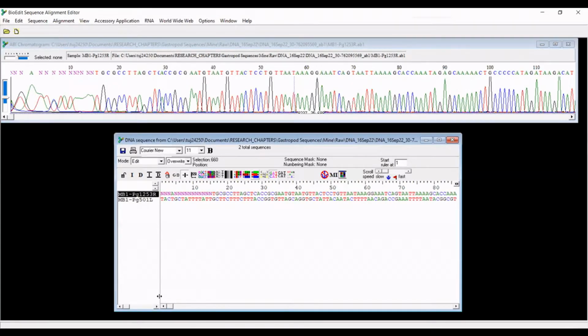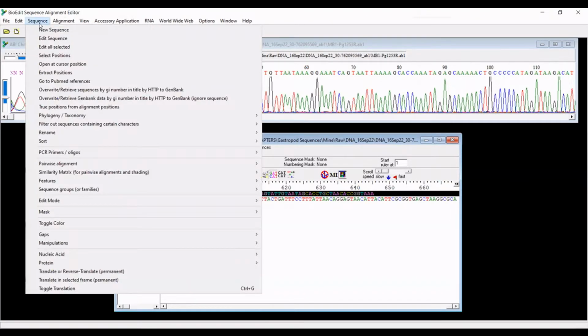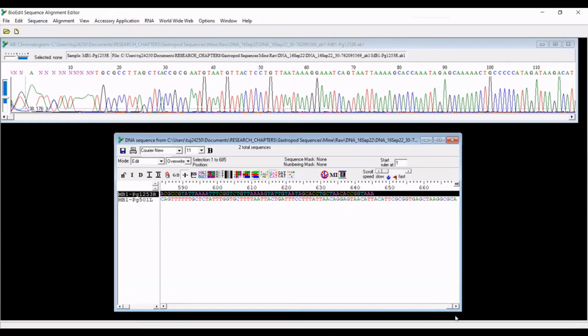We're going to delete the ambiguous regions. So everything looks honestly pretty good. Literally until it doesn't. So I'm not going to delete more than I have to, so I am just going to delete the unsure part. So I am at this point going to select this sequence only. And I am going to reverse complement this sequence.